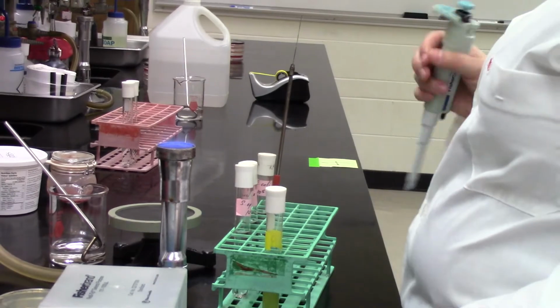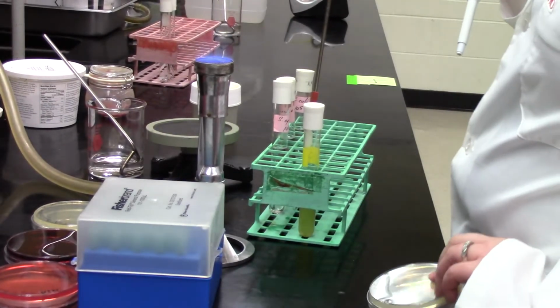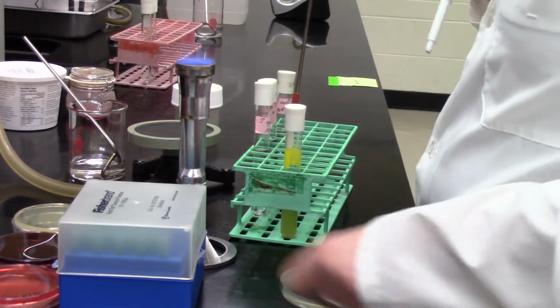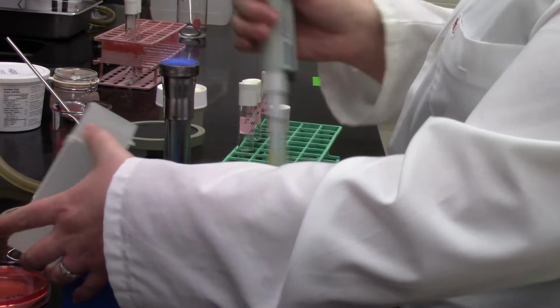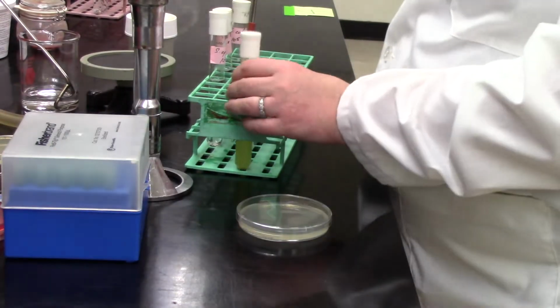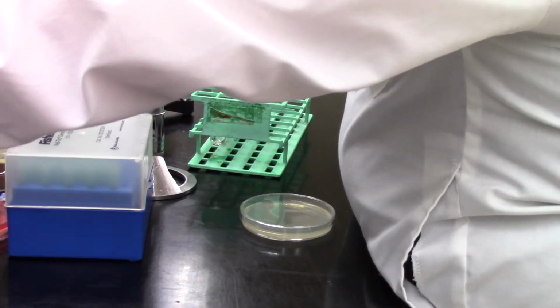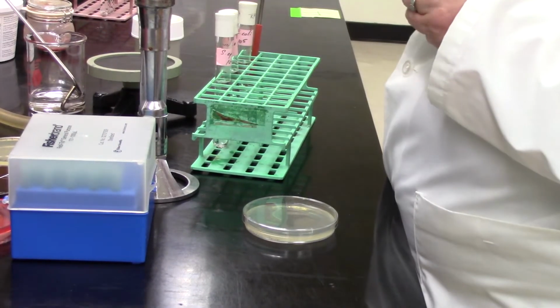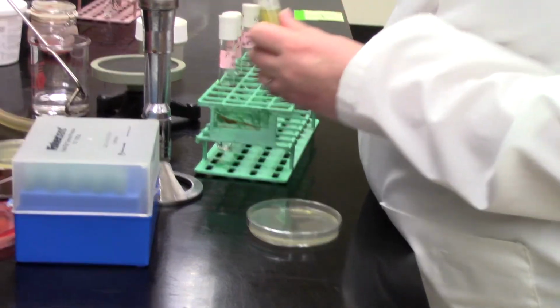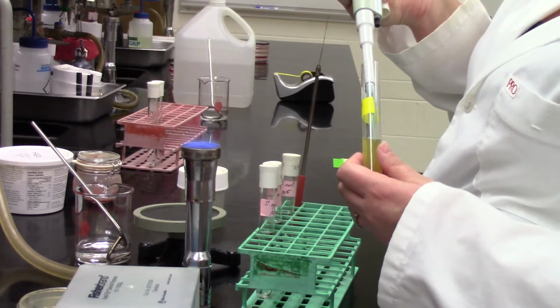Always lock that up again so it doesn't get bumped or jiggled and readjusted. And she can get ready to pipette now, using that micropipetter onto the surface of a spread plate. I think she's grabbed our first one there, which is our PEA media. She's just going to pull the lid off the tube, flame, reach in, and pull up 100 microliters.